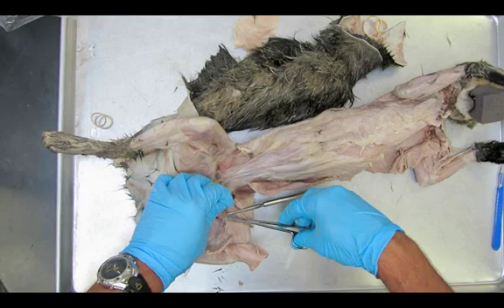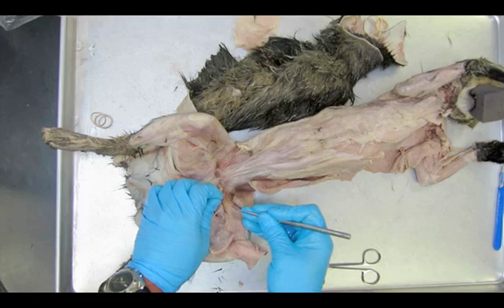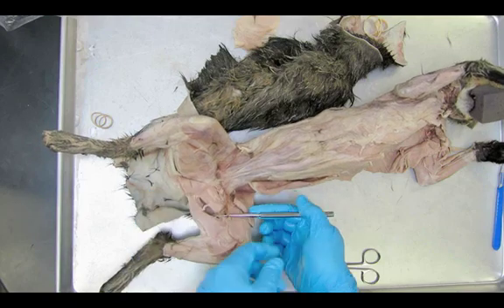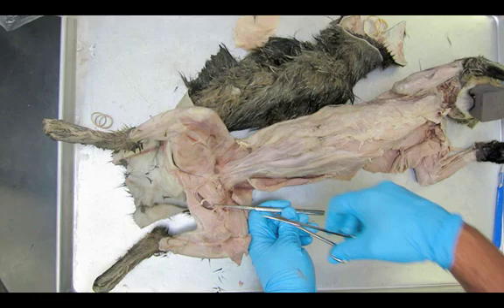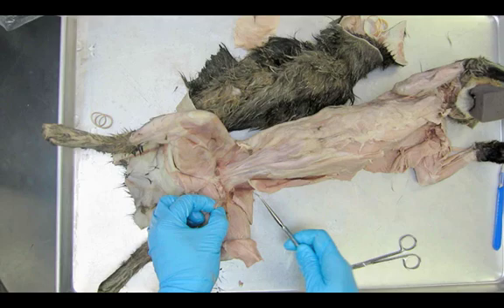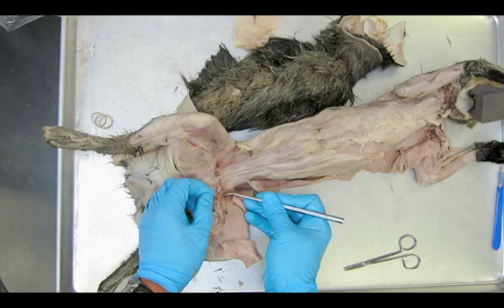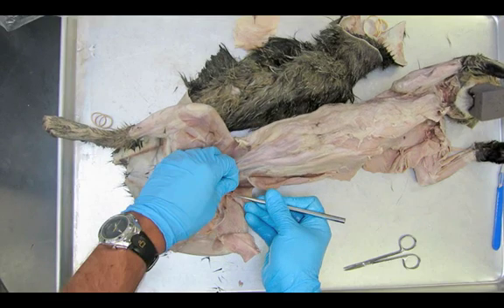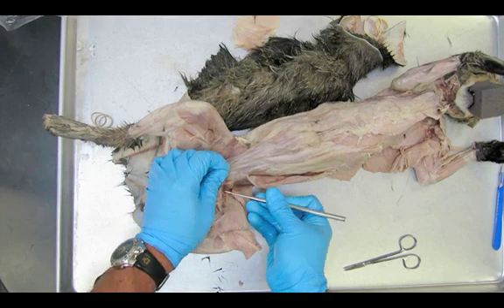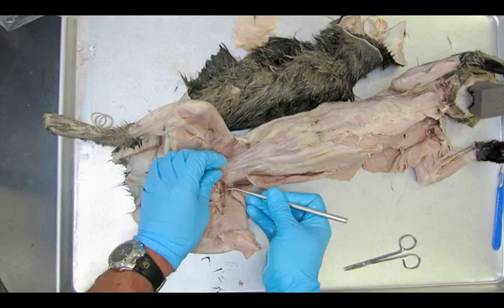What you can see me doing right now is removing a blood vessel. This blood vessel is actually helpful if you leave it on from the earlier dissection — as you peel it up gently it will help reveal the structures underneath, so we're not probing around with our blunt probe. This is probably one of the easiest dissections to mess up — very hard to finish without tearing the pectineus or the adductor longus.